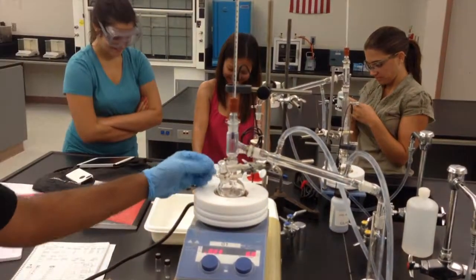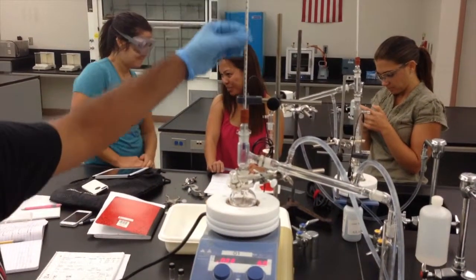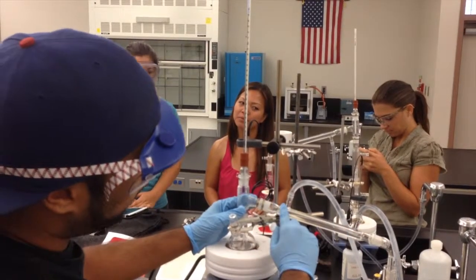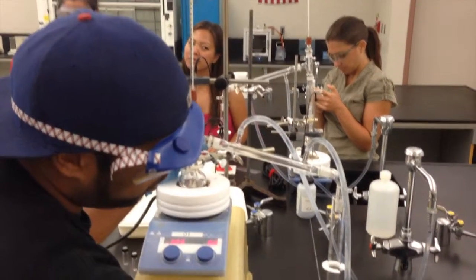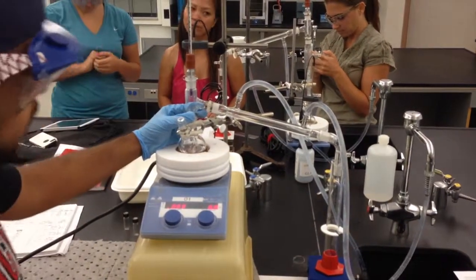The way this works is that once this starts evaporating, the thermometer right here will start picking up the temperature at the collection point, and once the vapor hits the cooling jacket right over here, the condensing tube, it will cool back down into its liquid form. Once it's in liquid form, it will collect in this graduated cylinder, and we'll be able to know exactly the amount of what we collected from our sample.